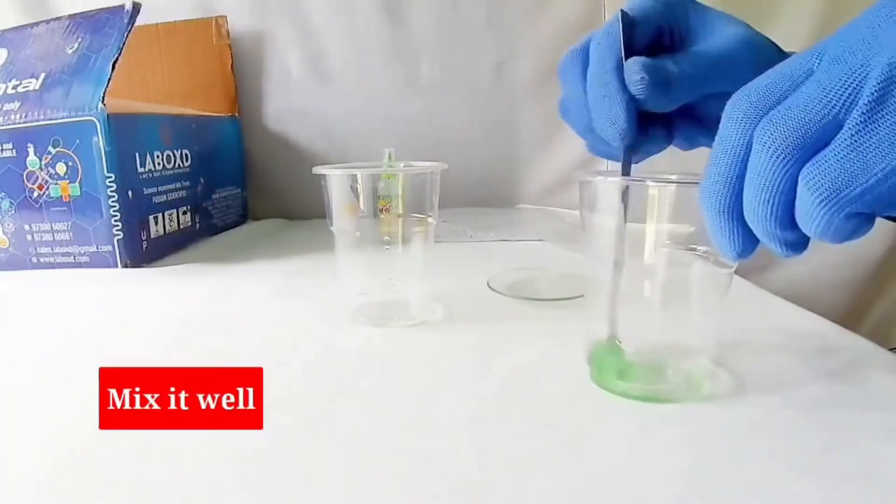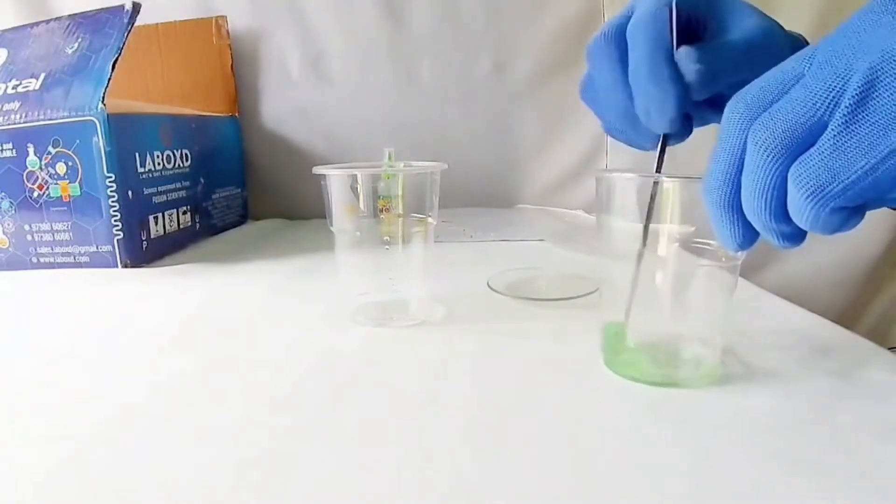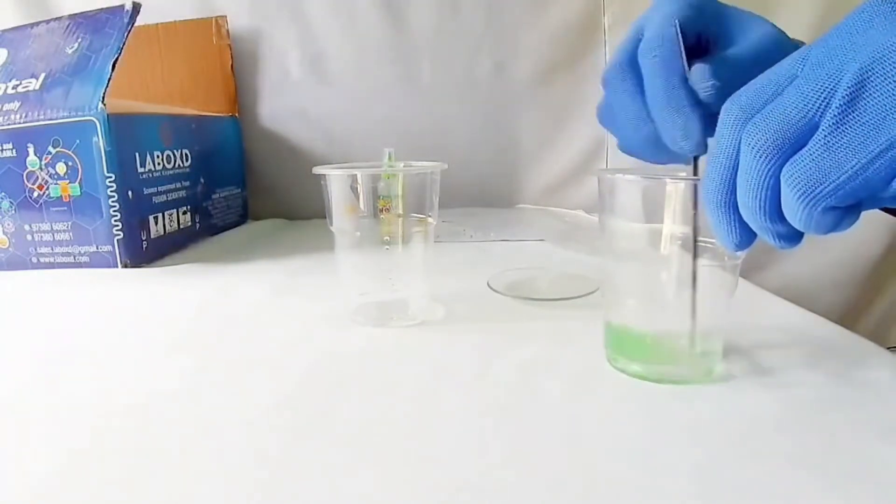We can observe that it changes to a solid substance. This is a polymer.